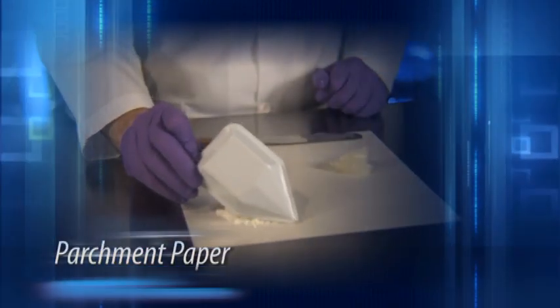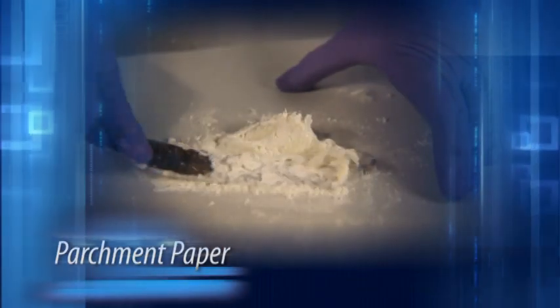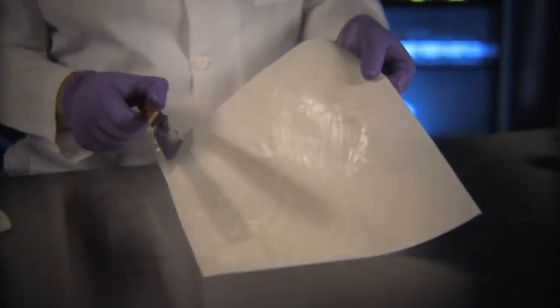Parchment paper is a special paper used as a substitute for an ointment slab when compounding semi-solid preparations. Although it is porous and may absorb some of the preparation being compounded, parchment paper protects countertops from being damaged and is often used to keep workspaces clean.